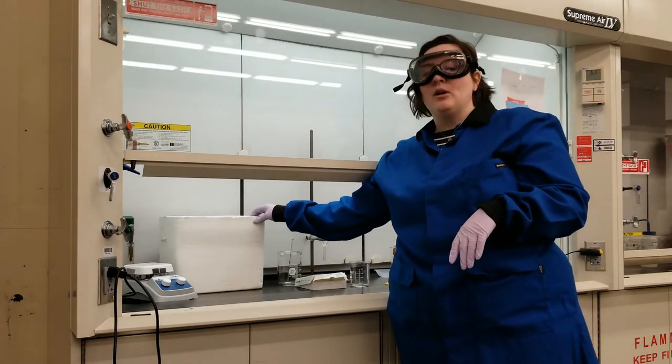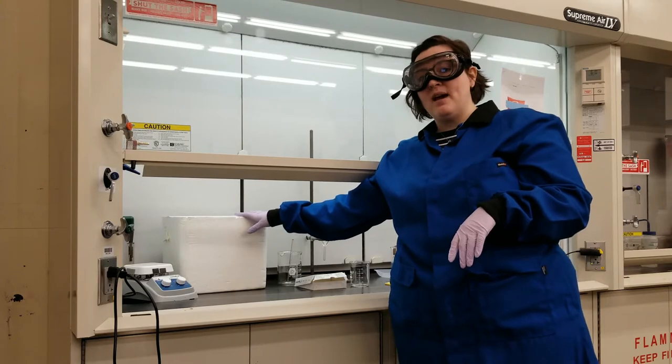And then at the very end, I'm going to want to check whether those fats are saturated or unsaturated, so I have an ice bath as well.